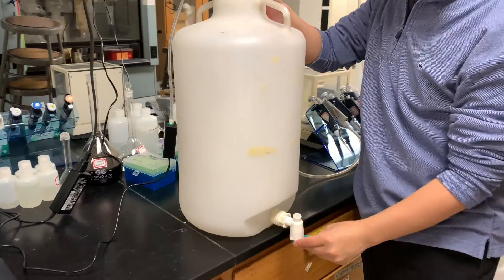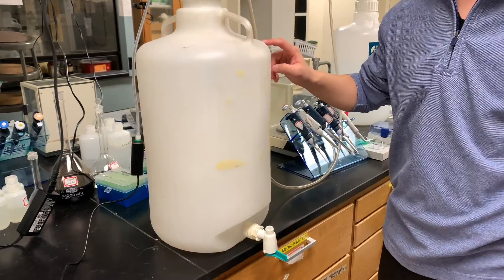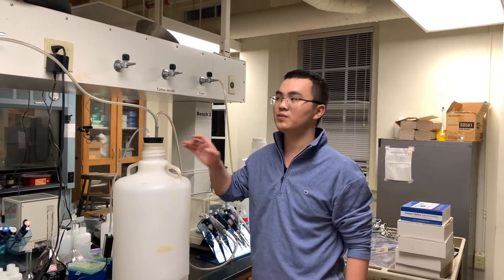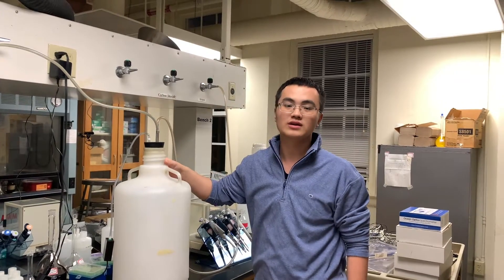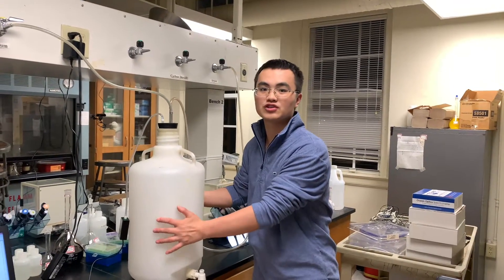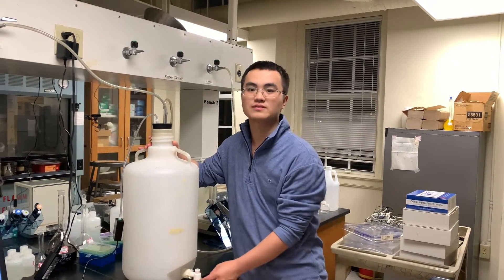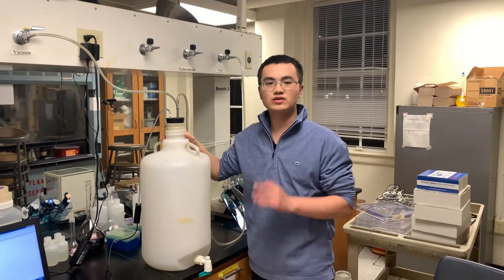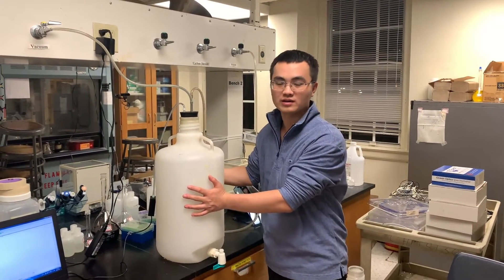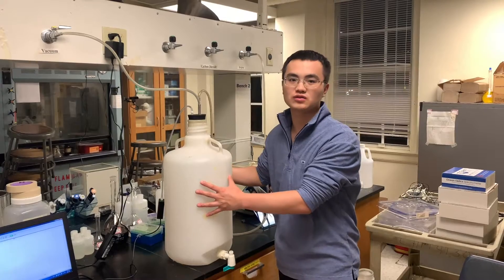The next step is to open the valve for the exhaust, then fill with argon and purge the system with argon for five minutes. After purging for five minutes, we will repeat the vacuum and purging processes three times in total. In that case, we will have the carboy system fully charged with argon, and then we will be good to do our first experiment. After three times of vacuum and purging, we have successfully filled the carboy container with argon gas.